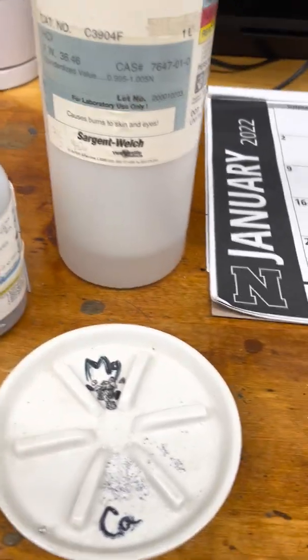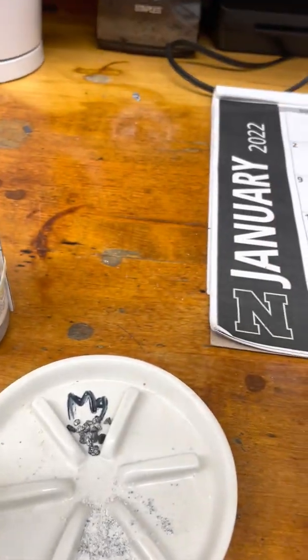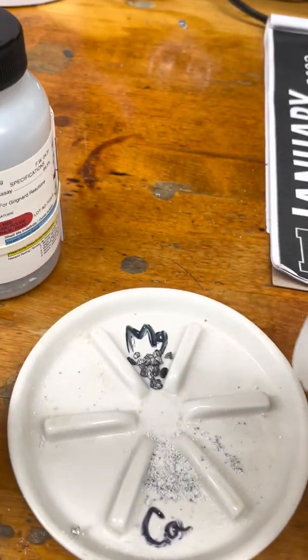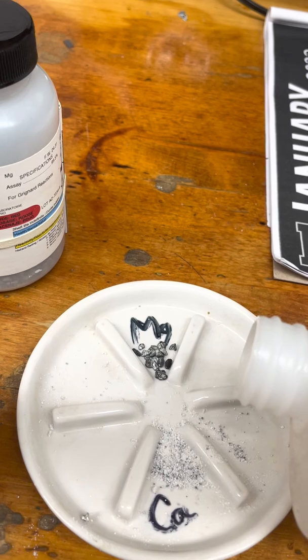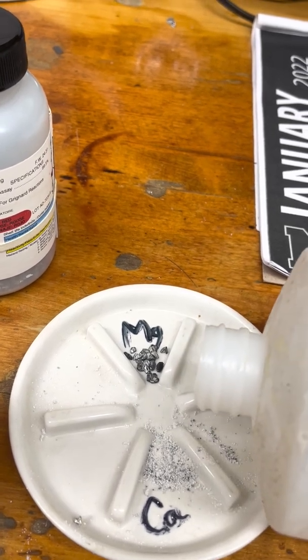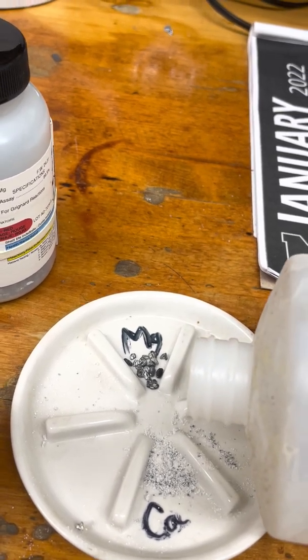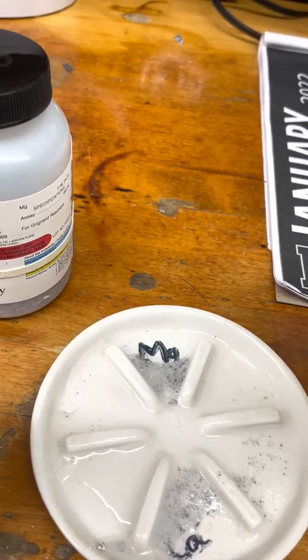So I have magnesium and calcium in there. I'm going to add the acid, and we're going to see how they react. We're going to observe their reactivity.